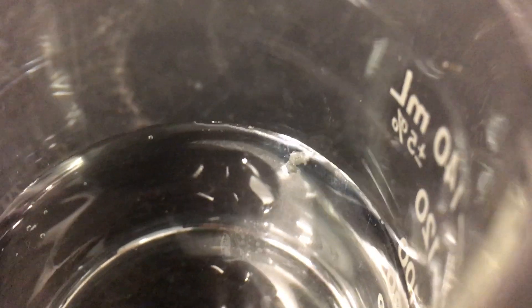As you can see, the lithium is beginning to react. You can see it kind of moving around, creating bubbles. And so this lithium is reacting — it's not dissolving, it's reacting with the water.